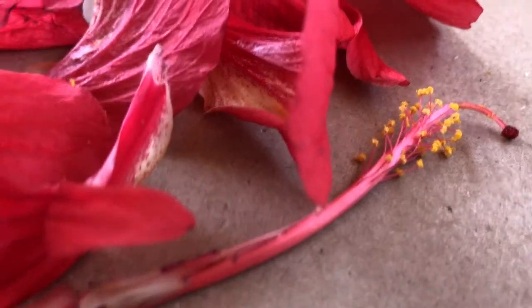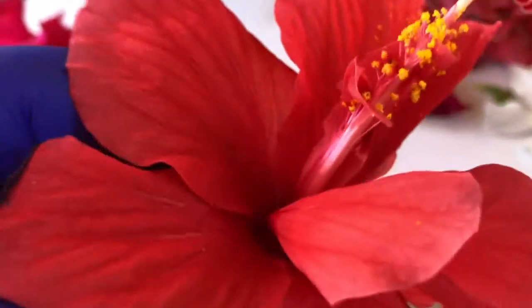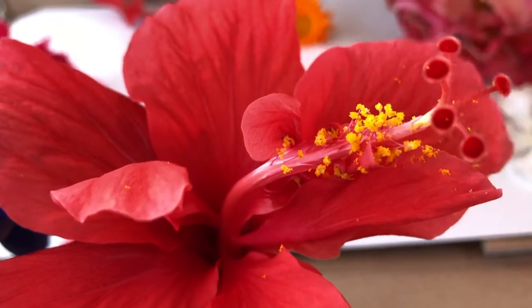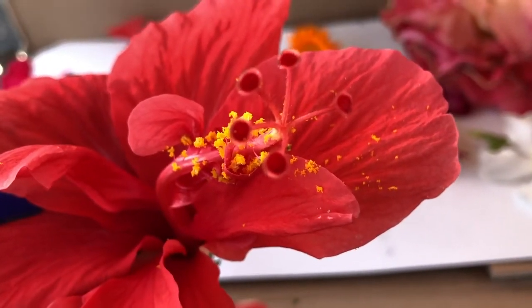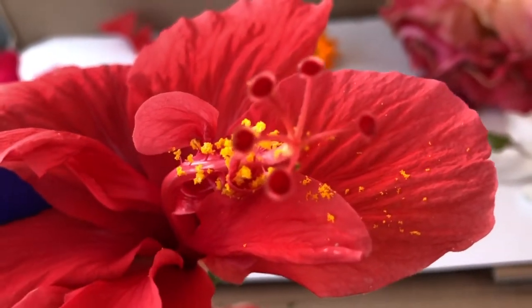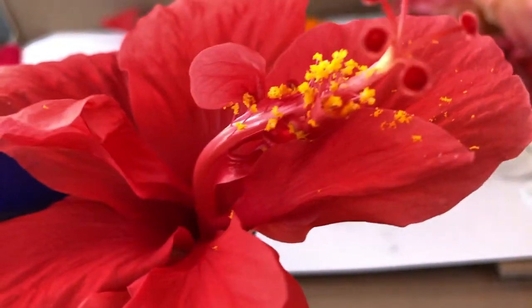And so what would happen is that when a bee comes in, I'll show you this flower again, when a bee comes in to get some nectar out of this flower here, it'll accidentally rub some of that yellow pollen on its underside. And then when it goes to the next flower, it'll land towards the top, tippy top piece between all those different stigma or red dots, and then that pollen would go down the pistil and ultimately into the ovary.